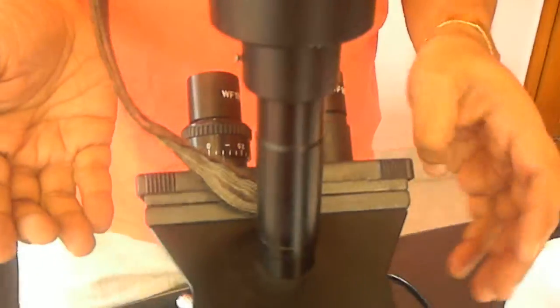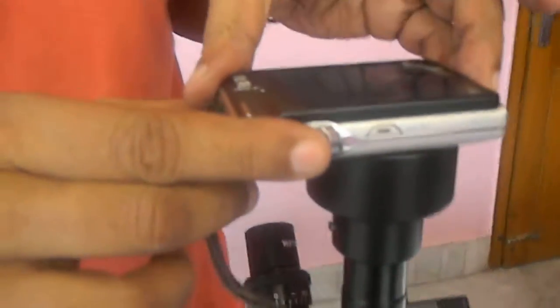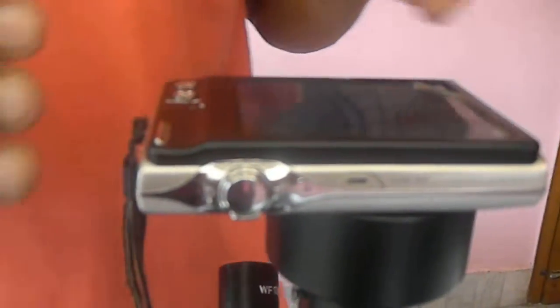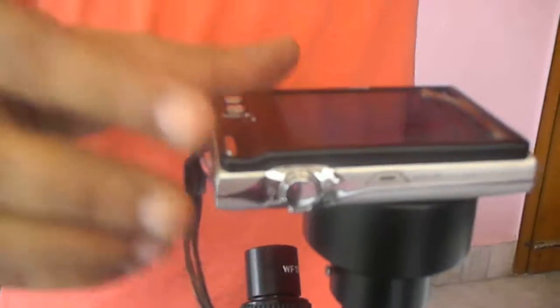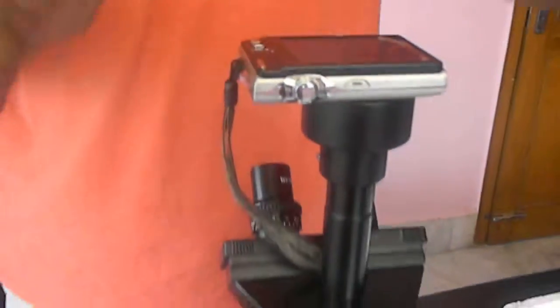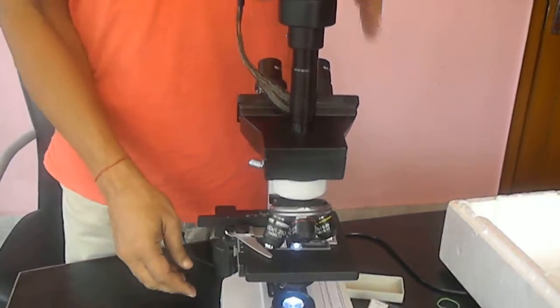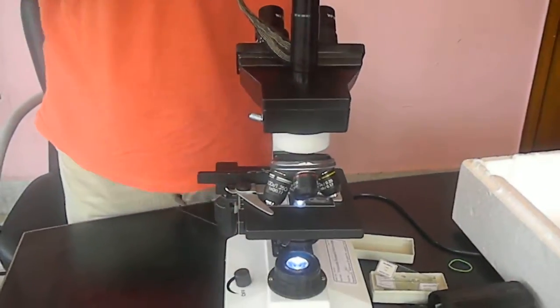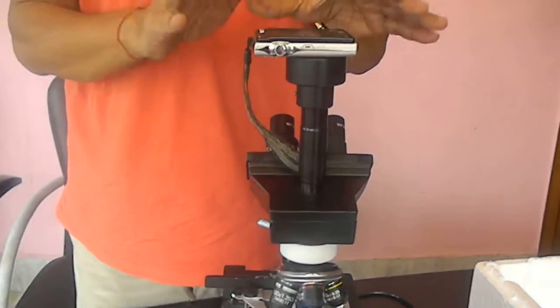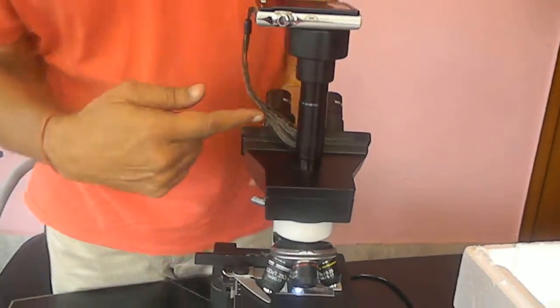The third image is clicked. Similarly you can do with the 100x. It's very easy. Let us learn some very important points again. This image is focused automatically. But the picture you can see yourself. When it is clear on the screen the image will be visible.